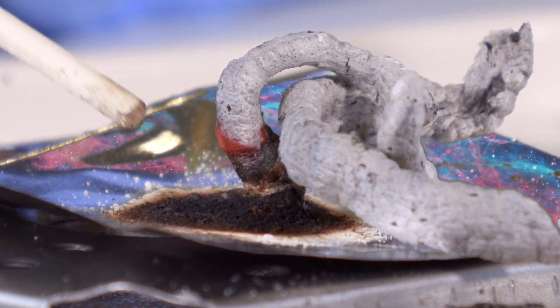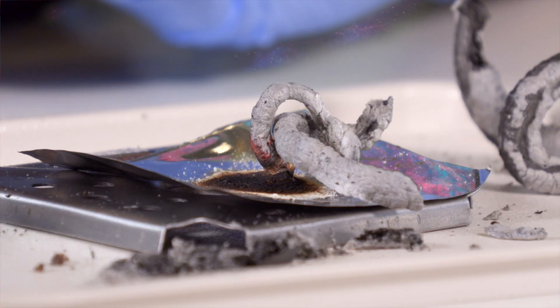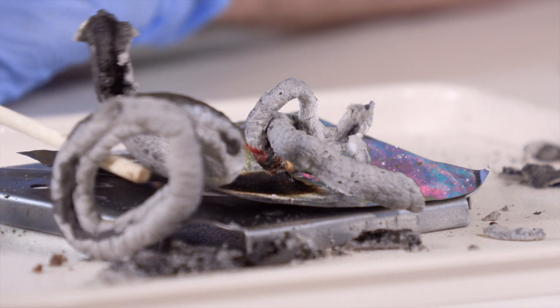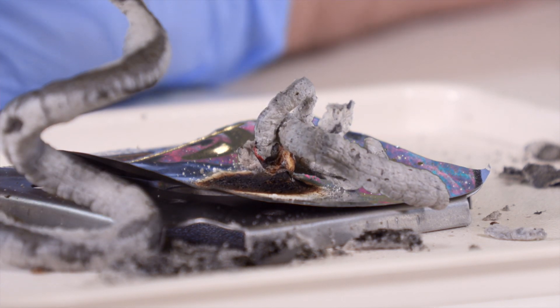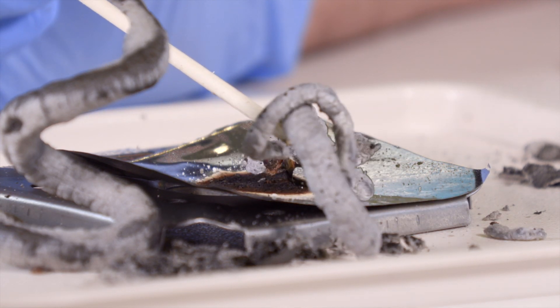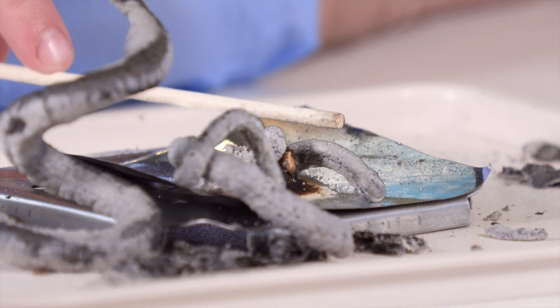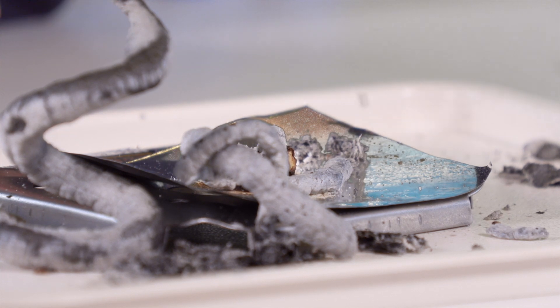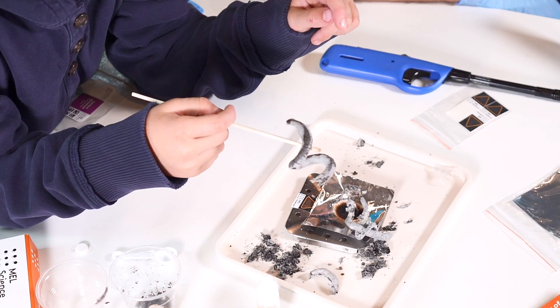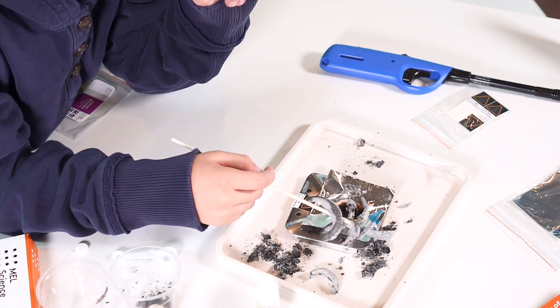Can I poke it? No, don't — I don't want you to burn the stick. Look at this one — pick it up and see how delicate it is. It made a little spring! As the little pellet gets worn away, the snake is getting smaller and smaller. Oh no, it came apart. Okay, let's try the other experiment. I wonder what the other experiment was.